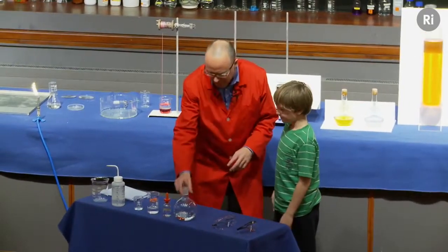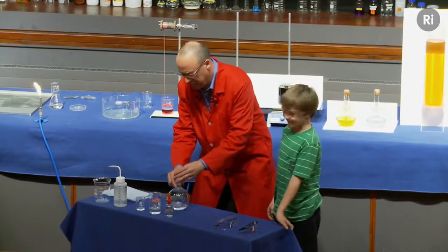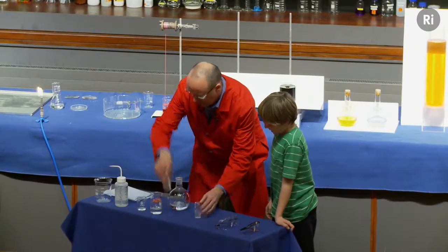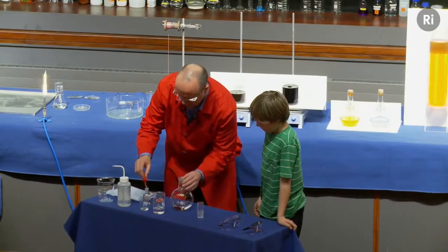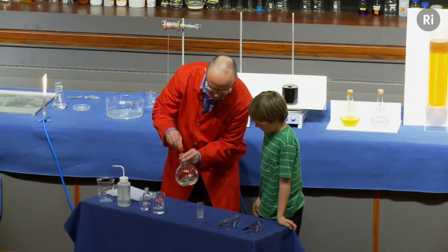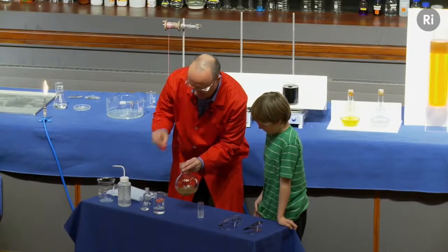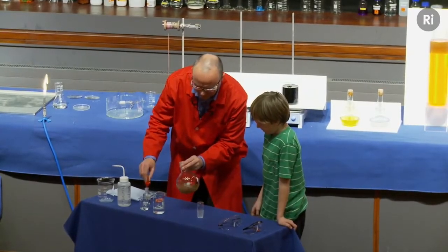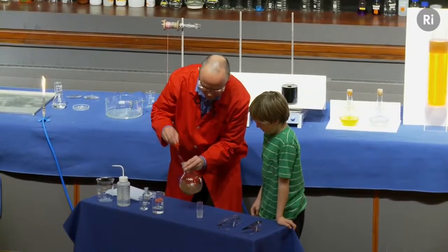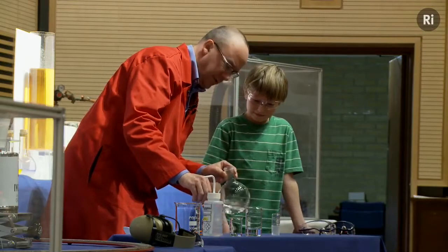We're going to do some chemistry and we're going to make a solid. All right, I'm going to start off with a flask that contains a solution of silver nitrate, and I'm going to add a little bit of ammonia. Now when I add the ammonia, you see that it's forming a sort of brown colour. I'm going to keep on adding the ammonia, and in a minute that brown colour should disappear. There we are, it's disappeared, isn't it?